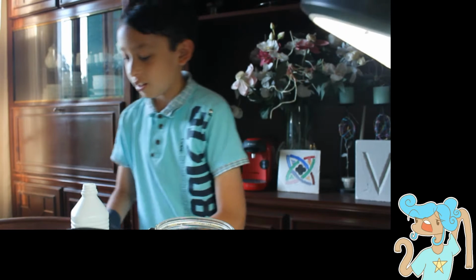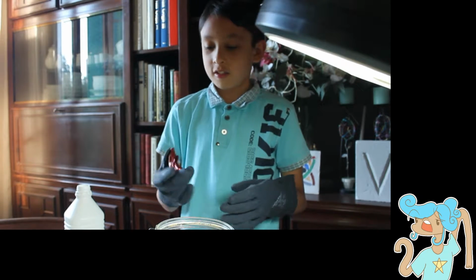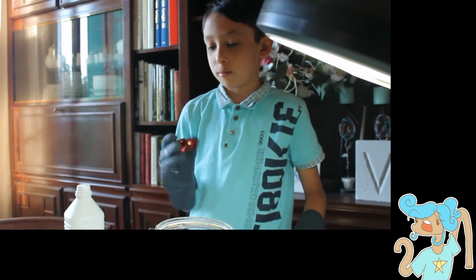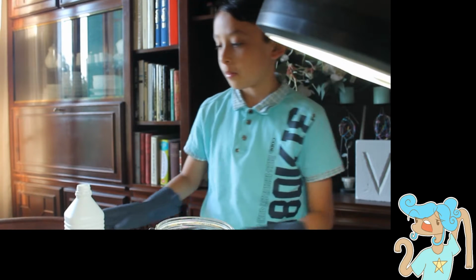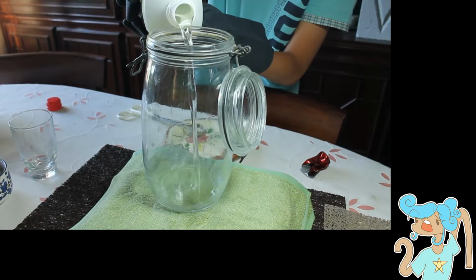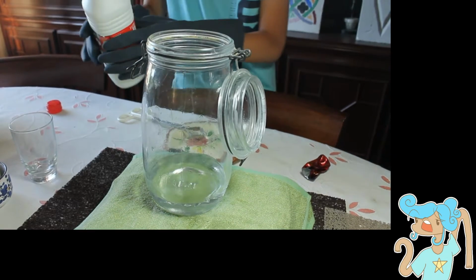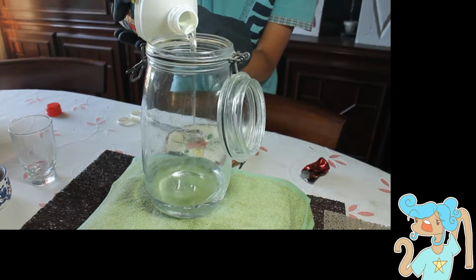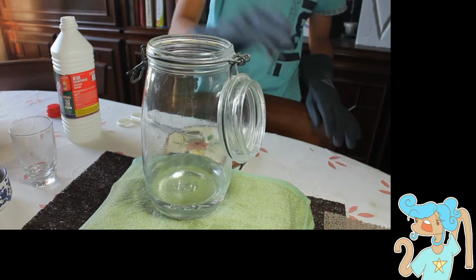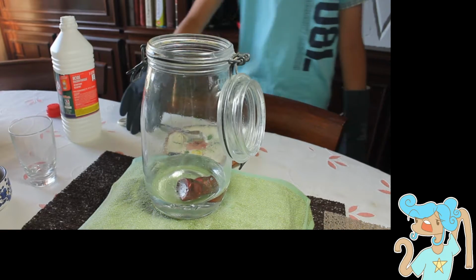Okay, so the next experiment is a lead wine bottle thing versus acid. We remind you that the acid is only 23% concentration. And the lead is in.